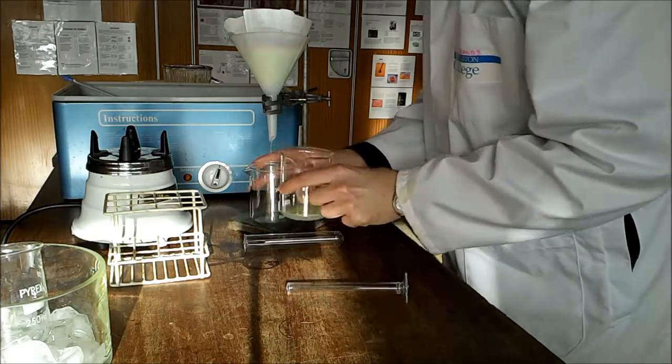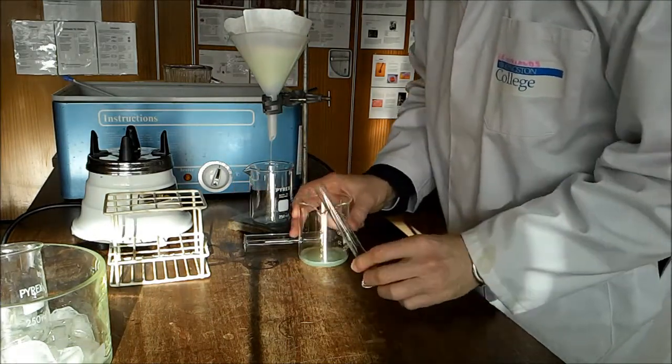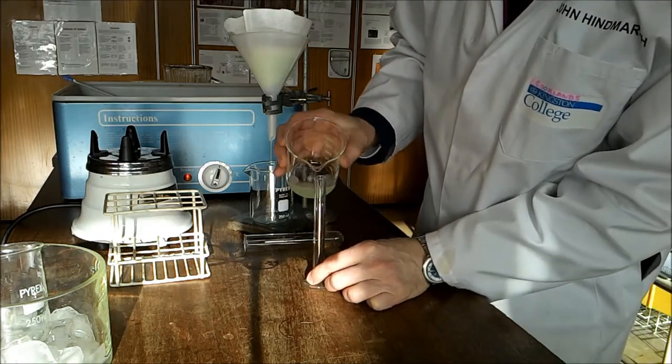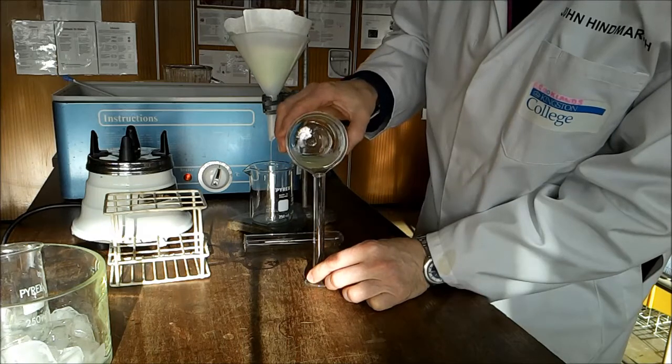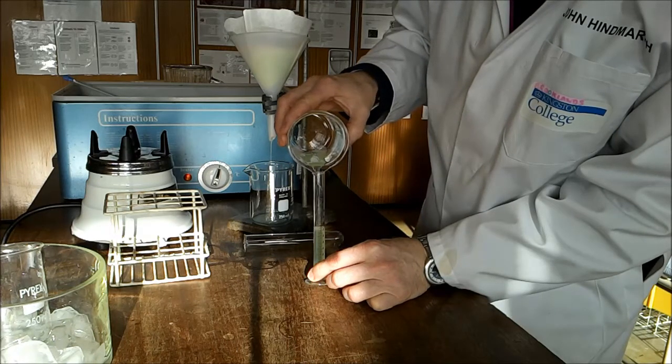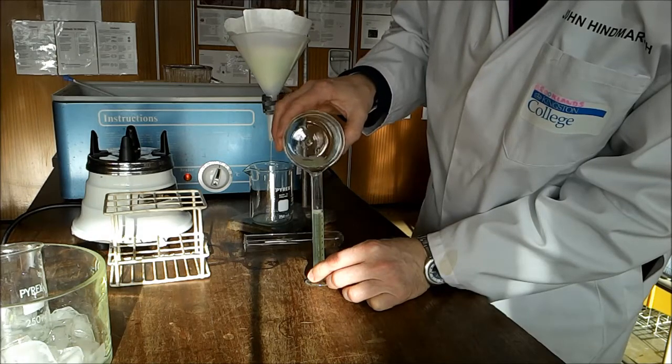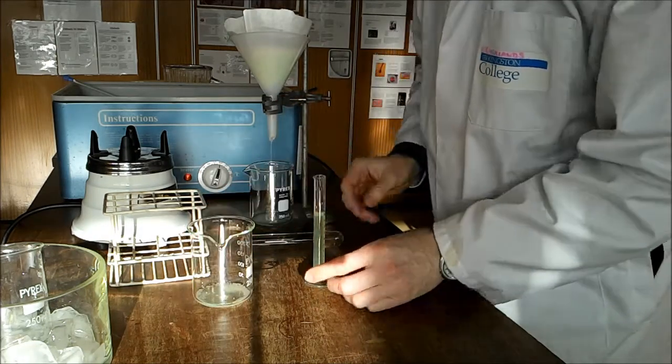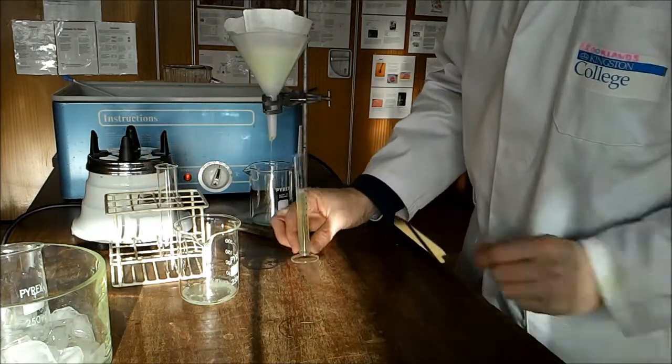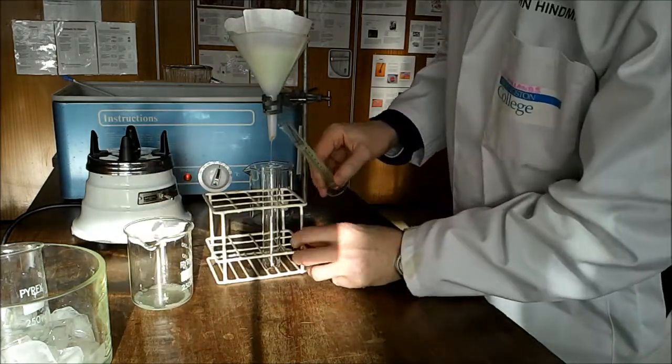As the solution comes through, we can measure out 10 milliliters of this solution and treat it with an enzyme.